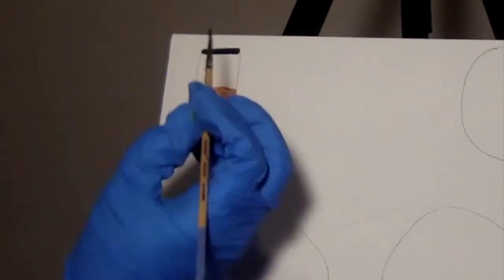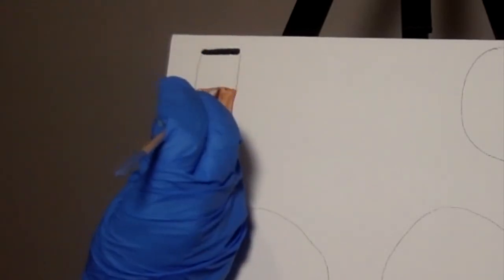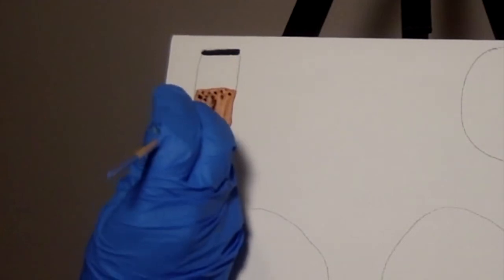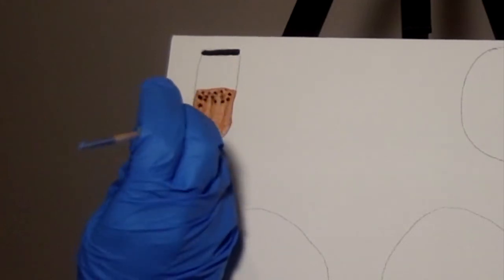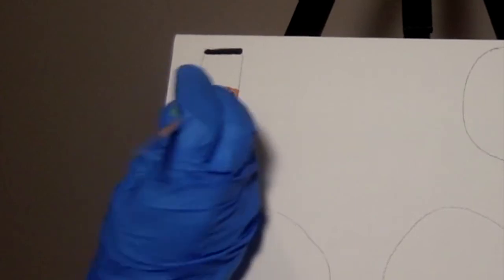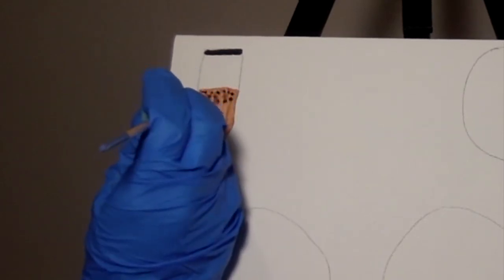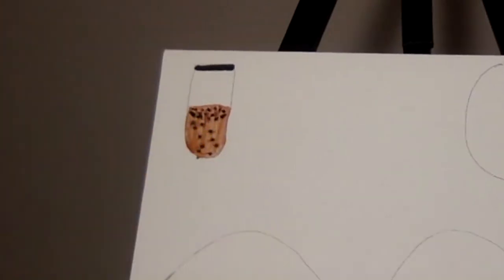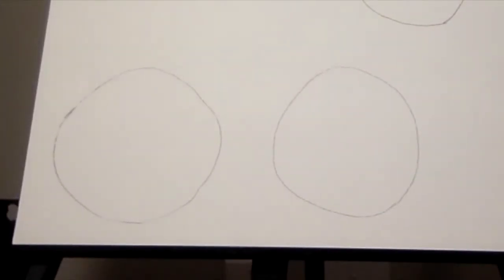And what we notice initially is that there's a high concentration of S. aureus that develops at the top of the tube where the oxygen concentration is at its highest, but also that there's some S. aureus throughout the rest of the tube. This means that it is a facultative anaerobe and that it can use oxygen when it's available, but also rely on fermentation if it's not.